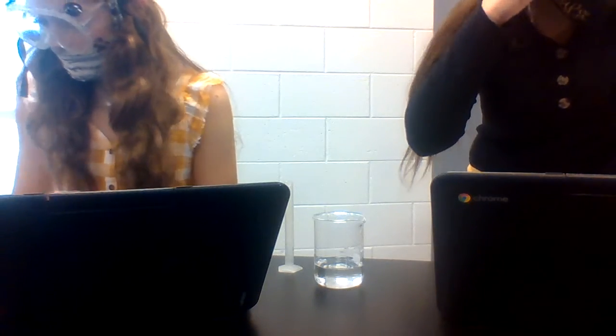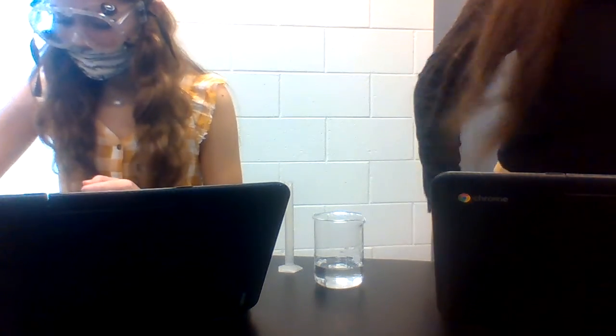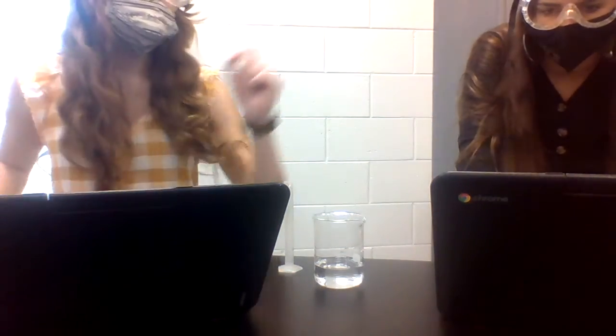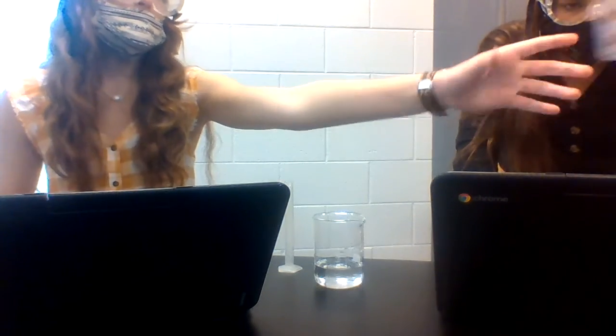So we're still doing... I don't understand. Where'd it go? There. Ask her if we're supposed to leave the water in there. Pass me the beaker. Wait, Bentley was out. Bentley, do I need to pour this? Are we supposed to leave the water in there? Okay, oopsies.